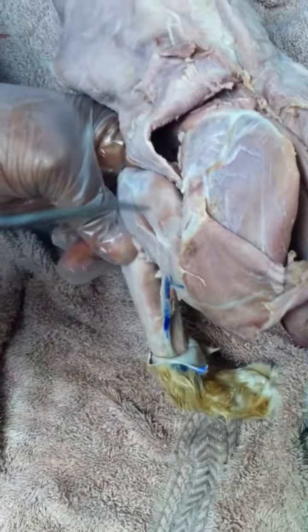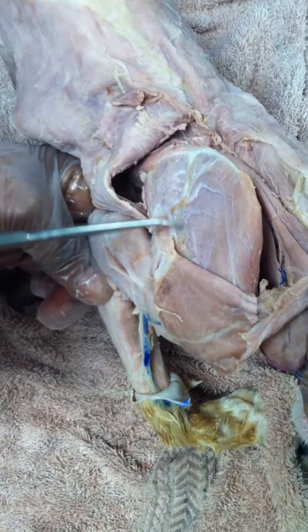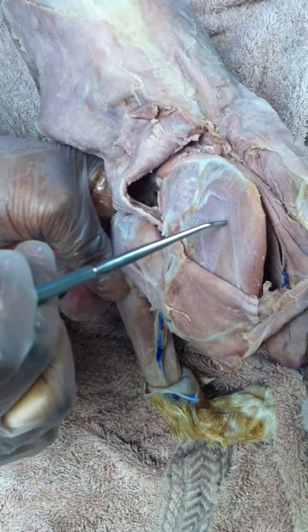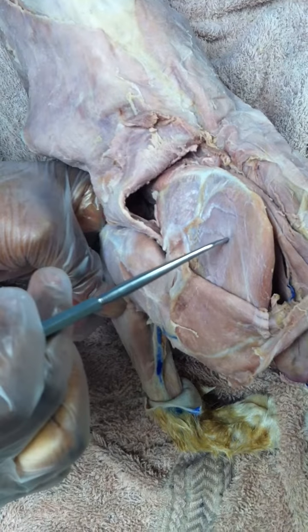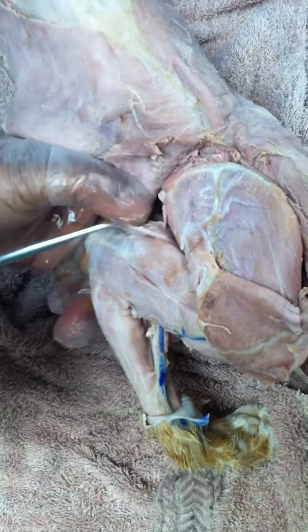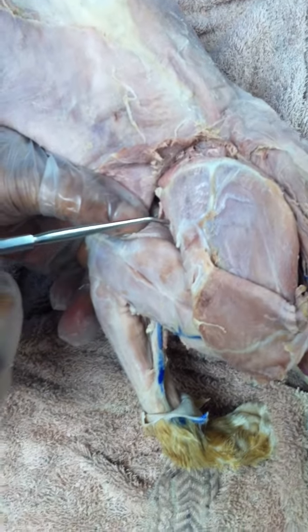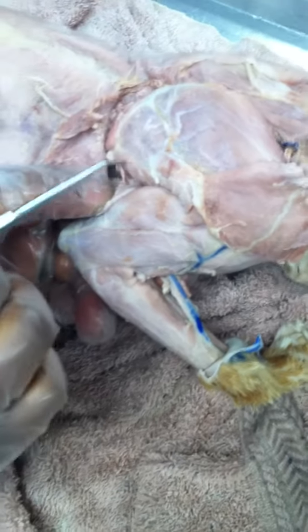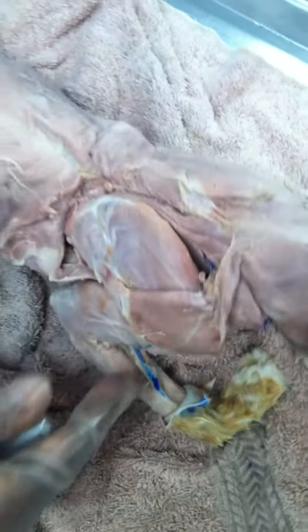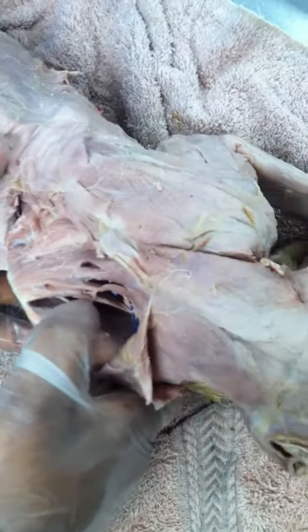And on the scapula, this is the spine of the scapula. So the muscle superior to that is supraspinatus. Inferior to the spine, that's your infraspinatus. And alongside the edge of your infraspinatus, that muscle there, that's your teres major. Okay. If you flip the scapula, you'll expose the rhomboideus muscles.